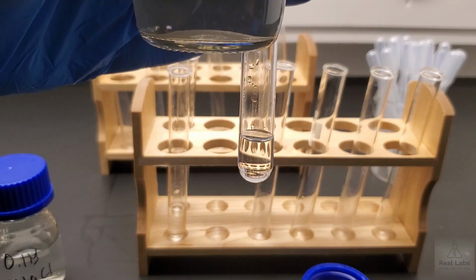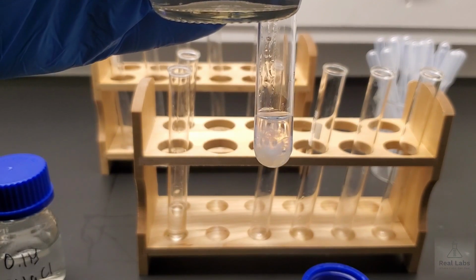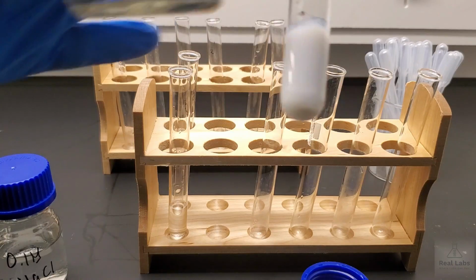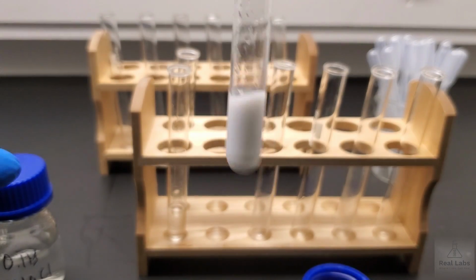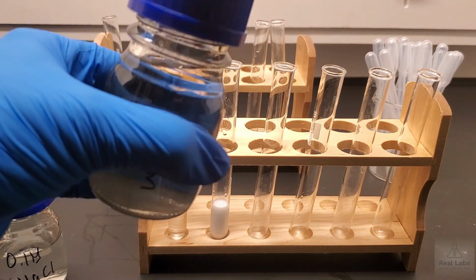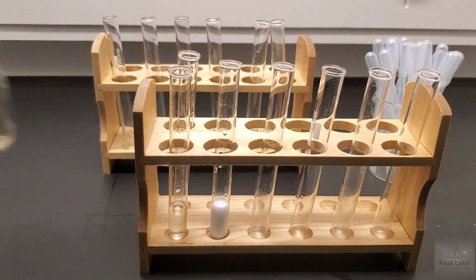So if I take the silver nitrate and I add about 1.5 ml of that to our system, you can see that it turns milky, and if you were watching closely you probably saw what was happening inside that liquid. You probably saw a solid being formed, and that's what dissipated throughout that liquid. So the addition of silver nitrate to sodium chloride gives you some kind of a reaction, so you should be writing down what you think that reaction is, whether you thought you saw a solid, a liquid, or a gas formed.